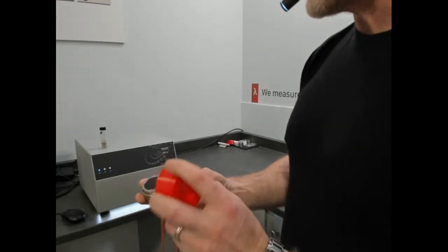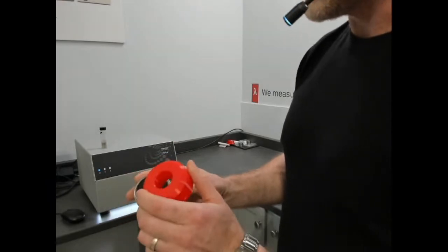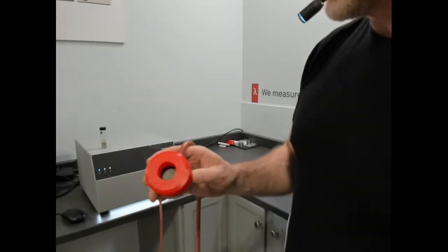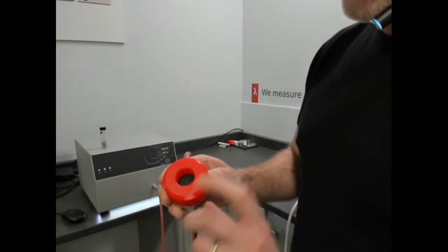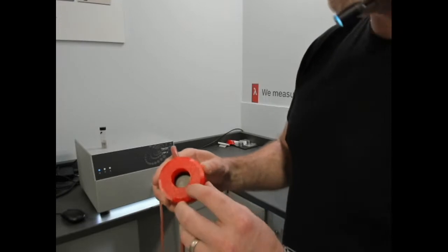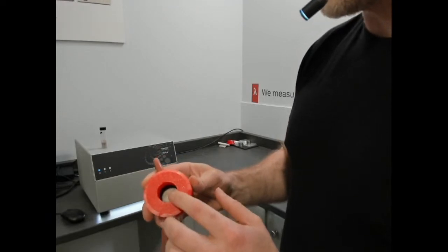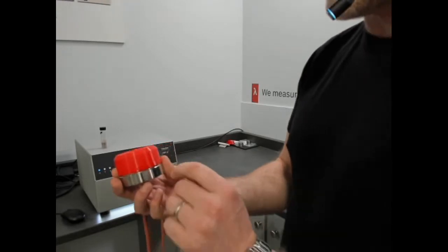So what we'll be demonstrating is when you acquire an MTPS sensor, there's an optional powder cell that you can add to it. All it is, is a 3D printed part that you clip in, and it leaves a volume. I think the volume is approximately calculable. It's variable, so I'll just describe the dimensions. That opening that is right over the double spiral sensor below it is 25 millimeters or an inch in diameter, and the height of that is at least 25 millimeters or an inch in height.